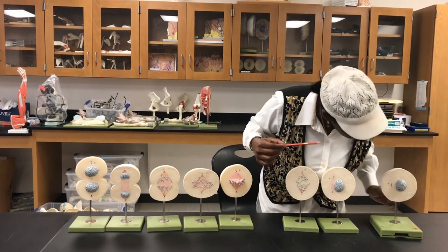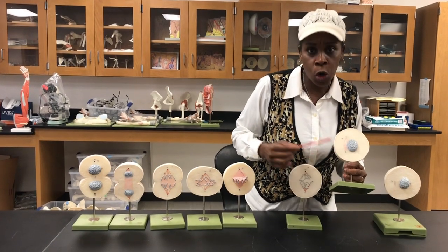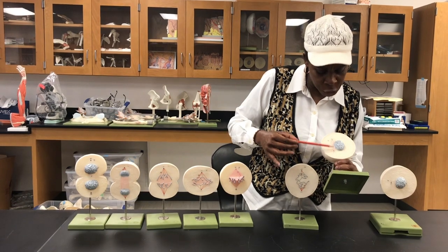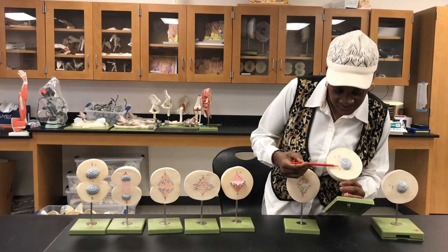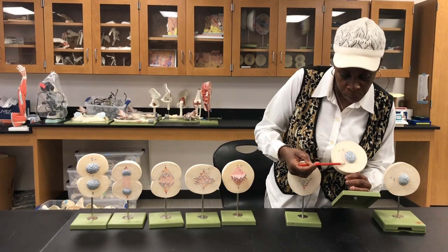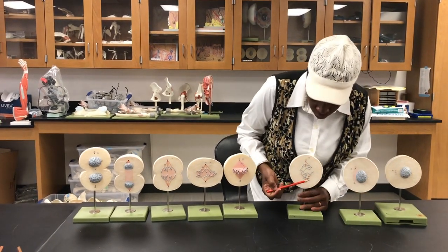On the next stage, you can see the spindles are forming a little bit. These spindles are nothing but microtubules that are holding the centriole on the top and bottom of the cell so that they can eventually pull the cell to divide the cell. That's why you see these microtubules, which we'll call the spindles, that hold the centriole on both sides to eventually move to the side here to divide the cell.